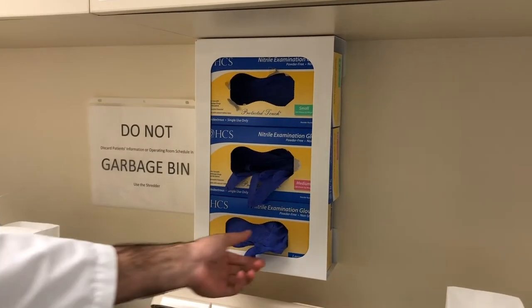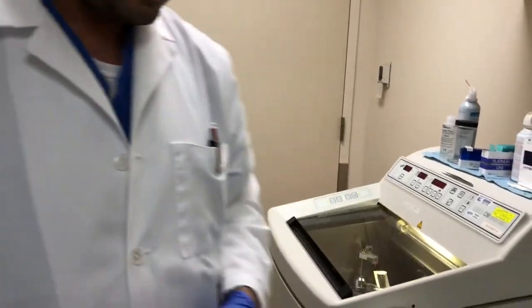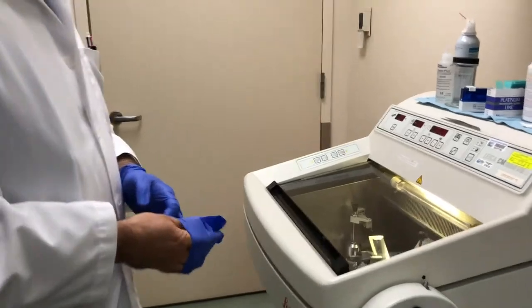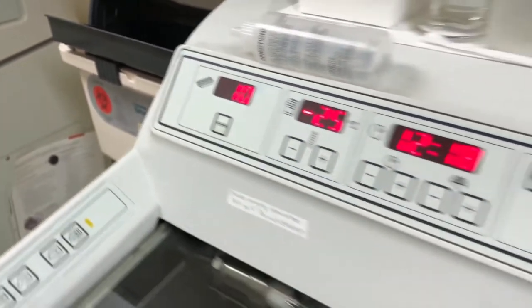Please grab some gloves before using any of the equipment. Turn the machine on and then turn the light on.